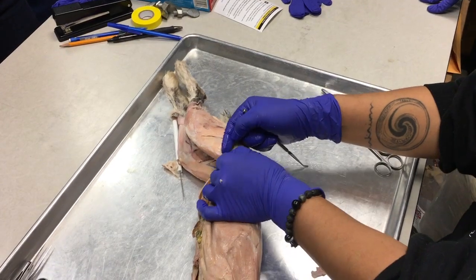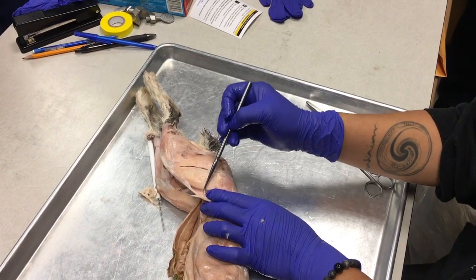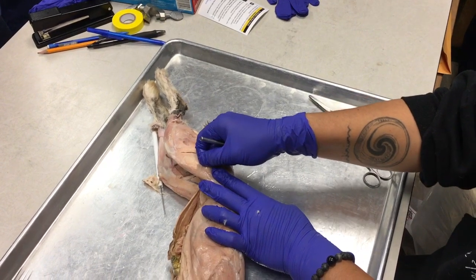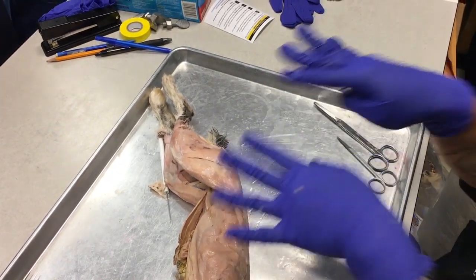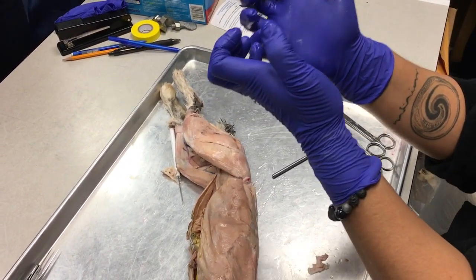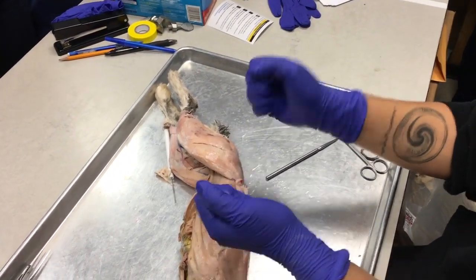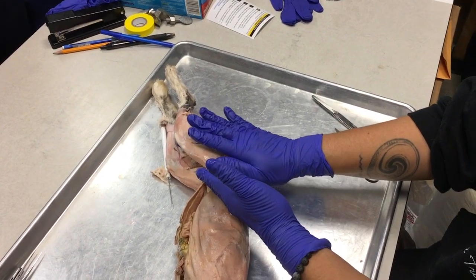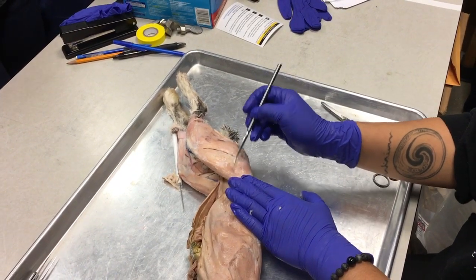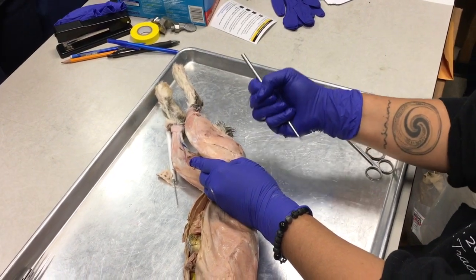So this muscle, if you can kind of look at the fascia right here, the muscle fibers kind of grow into that fascia. This fascia is called the fascia latae. And the muscle that has its fibers within that fascia, its job is to hold that fascia tense. So it's contracting all the time to keep tension on that tendon in order to keep the leg in proper tone. Okay, that muscle is called the tensor fascia latae. Okay, so it's inserting into the fascia latae and it's keeping that fascia latae tense.